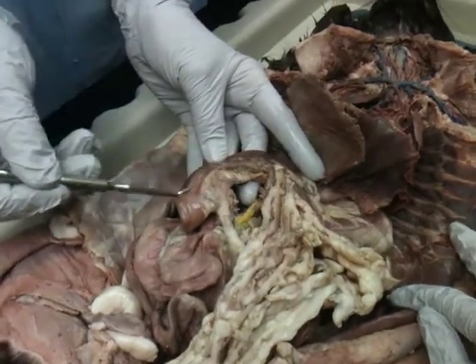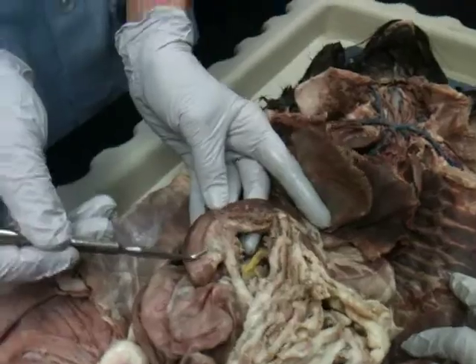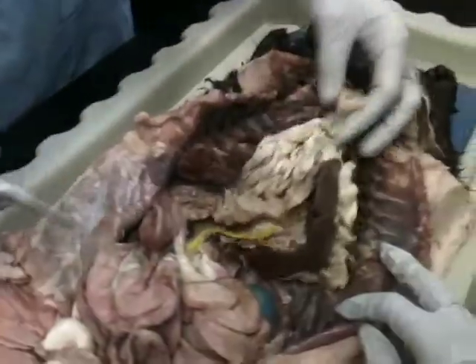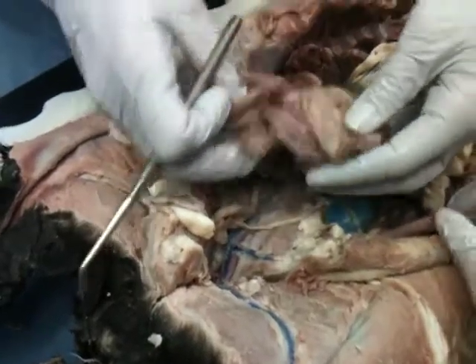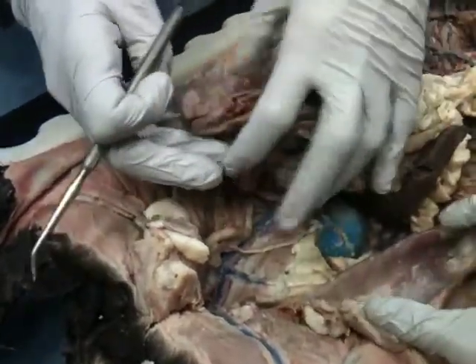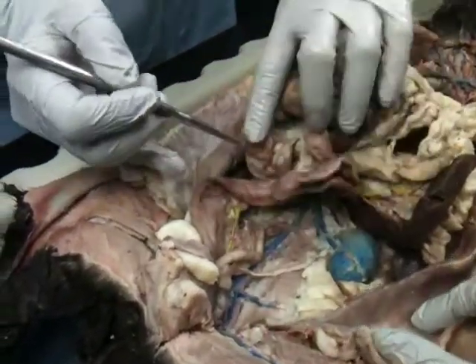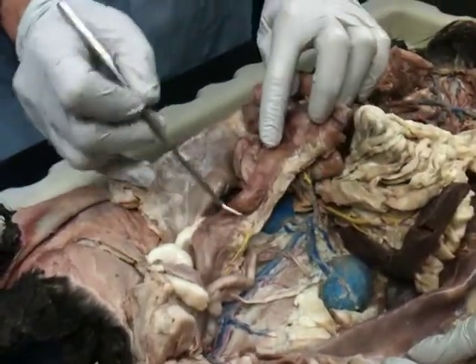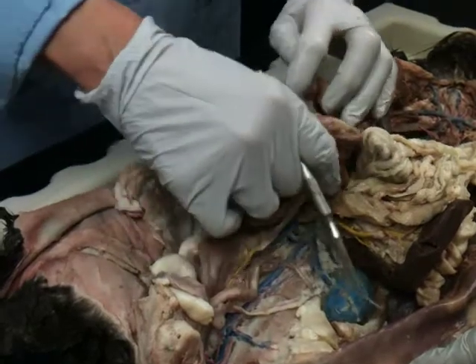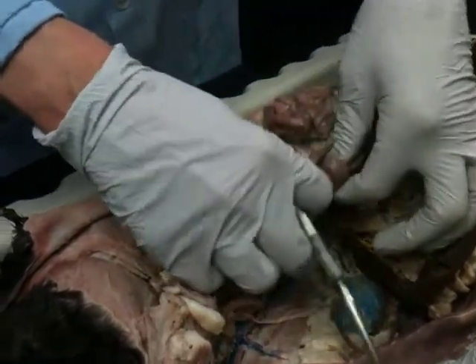So we have the beginning part, the duodenum, of our small intestines. It goes down to the small intestines. Basically, you need to know that. Small intestines, which will then become the colon, which is the large intestine. It's just larger in size, and structurally it is different.